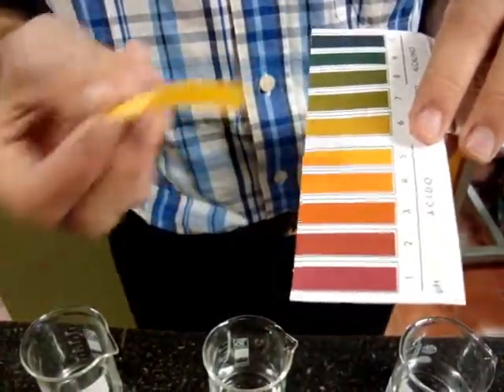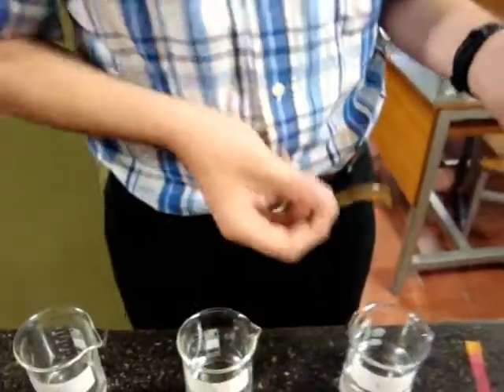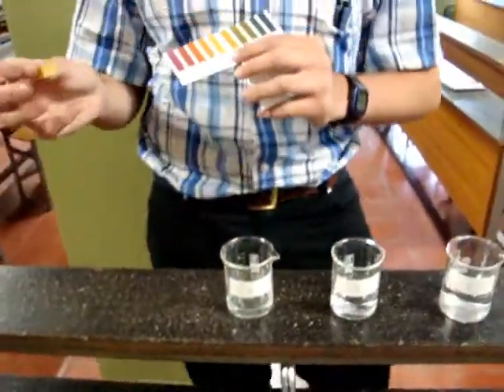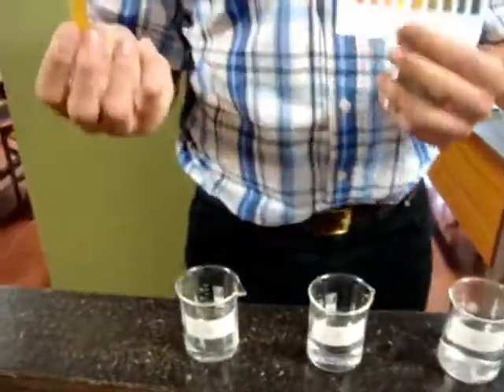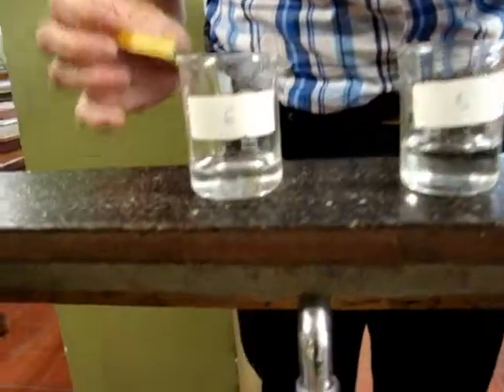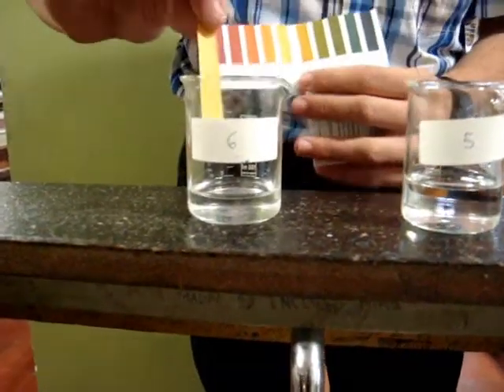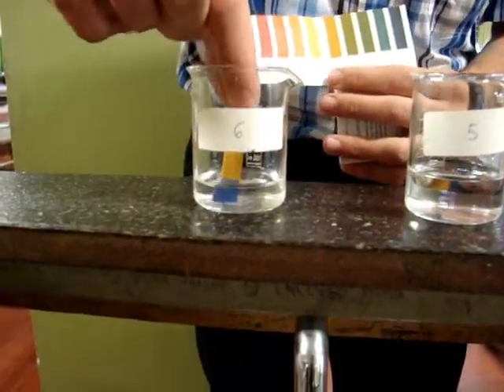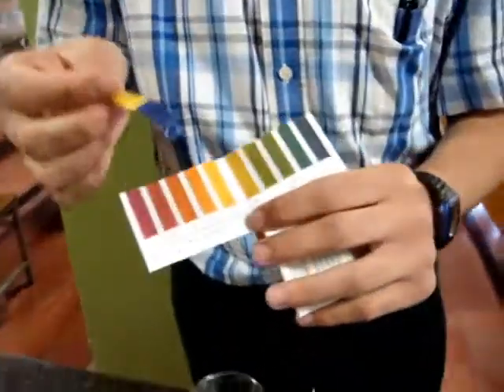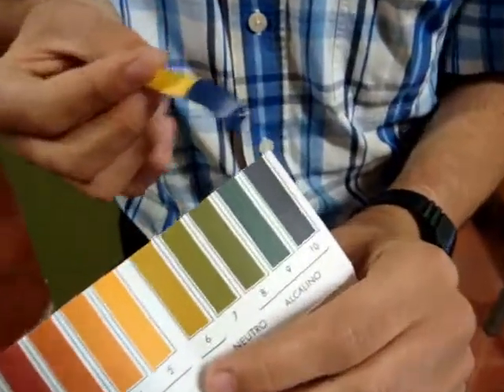The acidity and basicity are equal in neutral water. But now we are going to use another stripe in the hydroxide. And we are going to insert it. And as if it were a trick of magic, it becomes blue, dark blue.